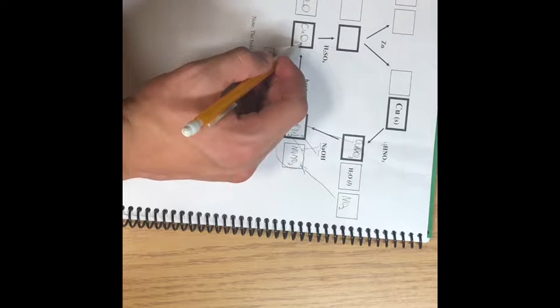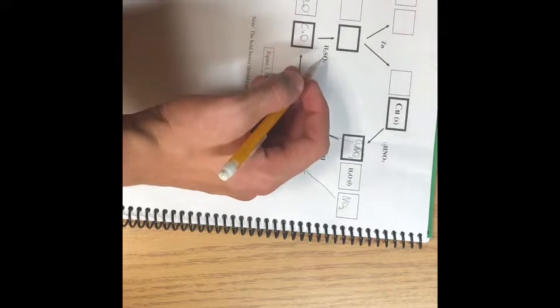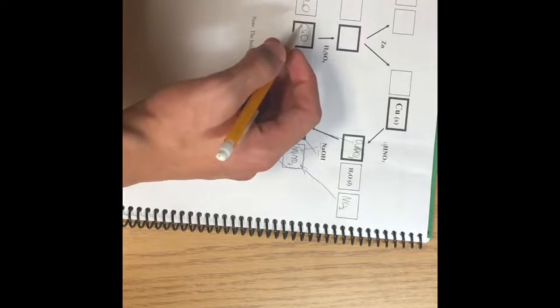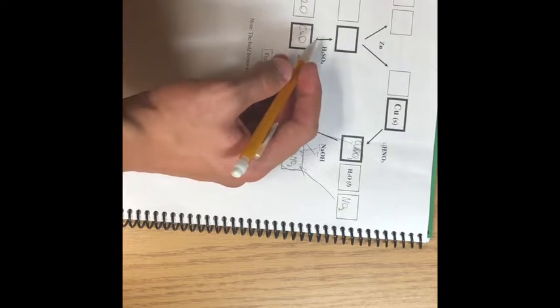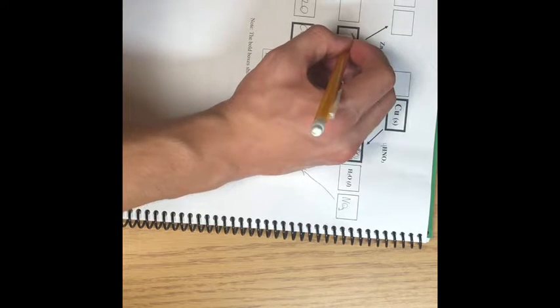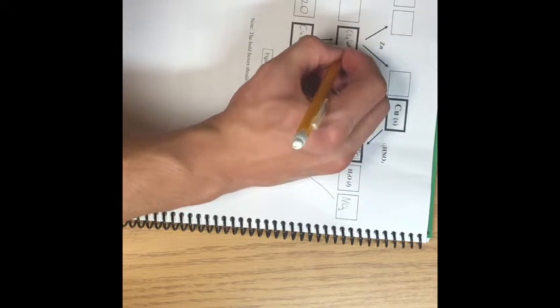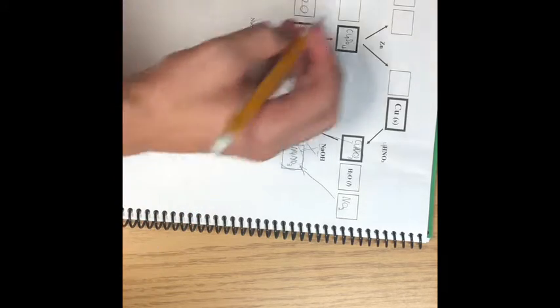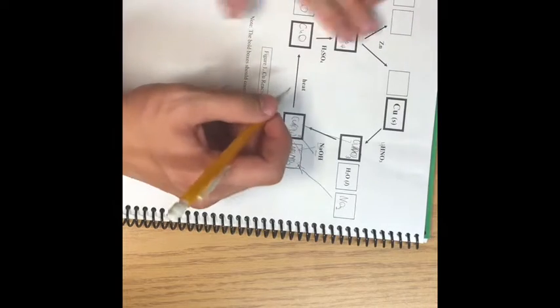Alright. And then sulfuric acid was added to the copper oxide solution, which turned the black substance into a clear blue homogeneous solution, which was later found out to be copper sulfate. So let me write that down. CuSO4, which is copper sulfate, and since it's soluble in water, H2O is still found in this reaction.